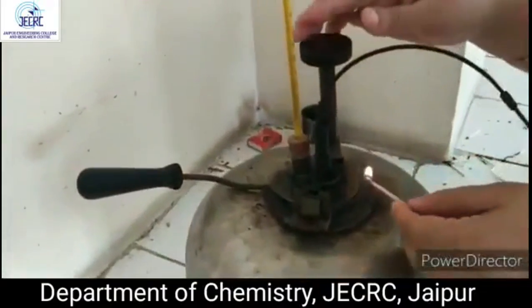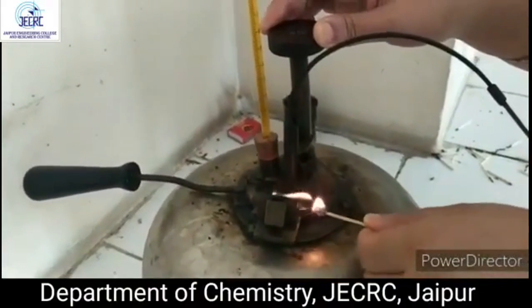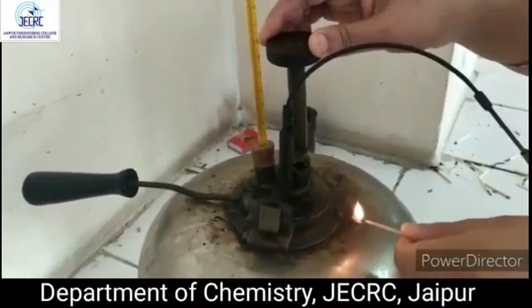Now again we will take the reading. This is the fire point.